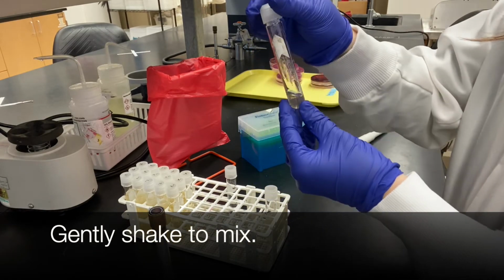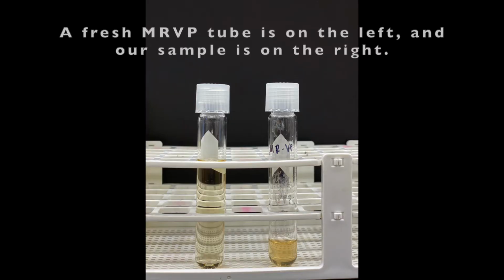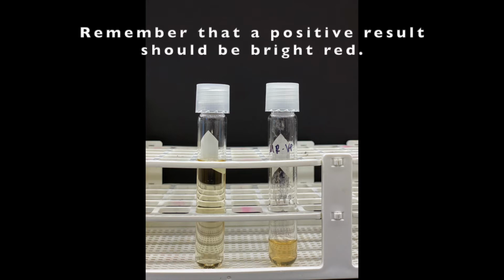Gently shake the tube to mix. A fresh MRVP tube is on the left and our sample is on the right. Remember that a positive result should be bright red. The following experiments will be conducted on day 5, or after 96 hours from inoculation.